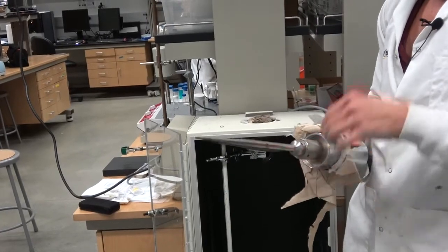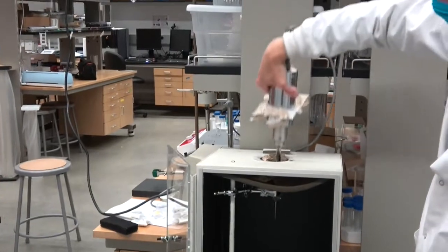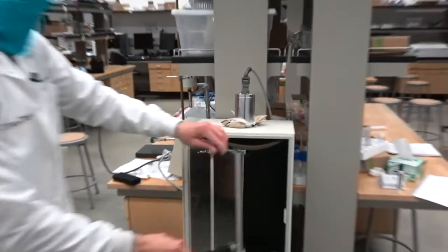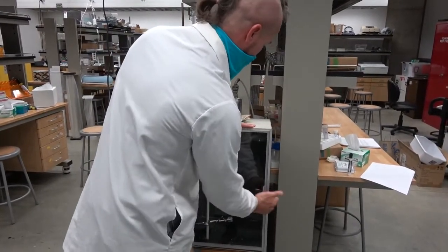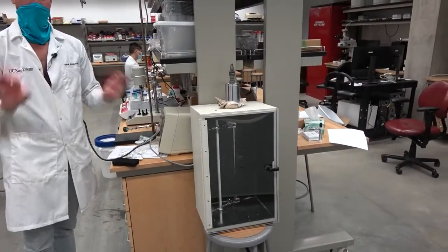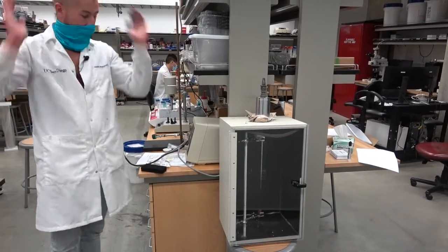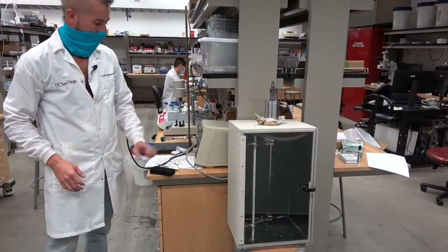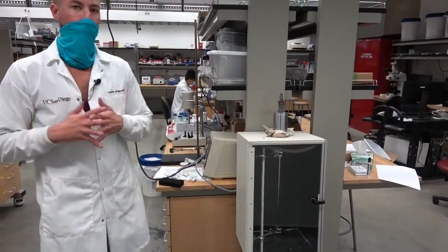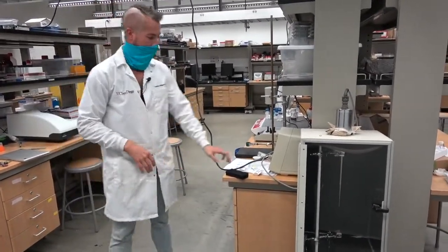But this will put a ton of energy into whatever liquid you have it in. You have to put it inside of this chamber to protect people's ears. You can kind of hear it. It's a little whack right now, but when I turn it on, you can hear that really high-pitched sound. If you use this for long periods of time, you've got to wear earmuffs or earplugs to protect your ears. So these are different ways of basically shaking up your oil and water.